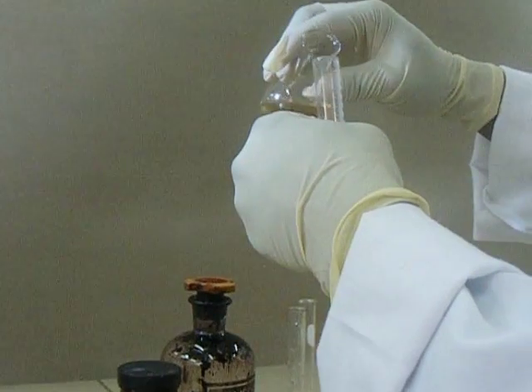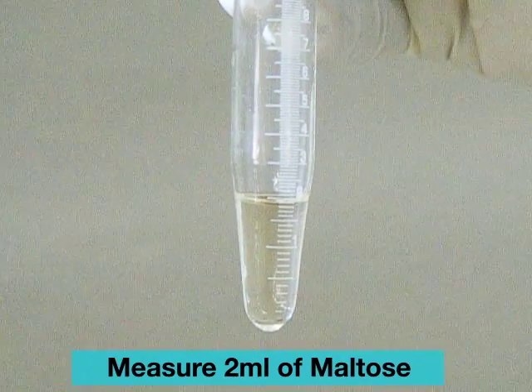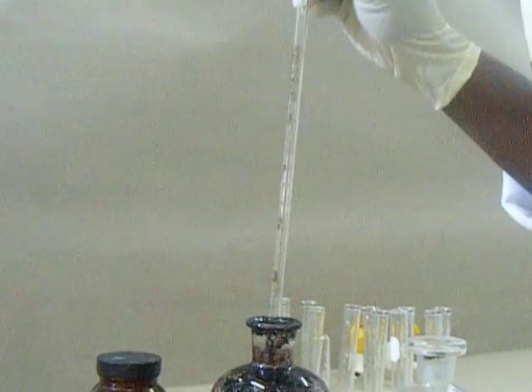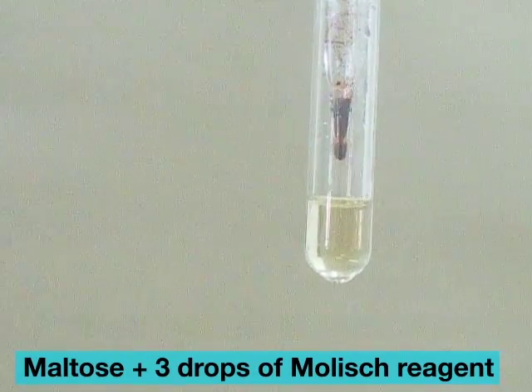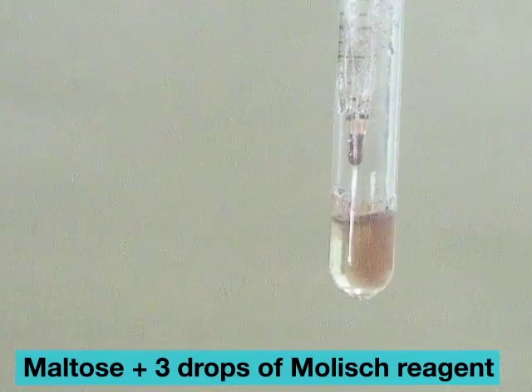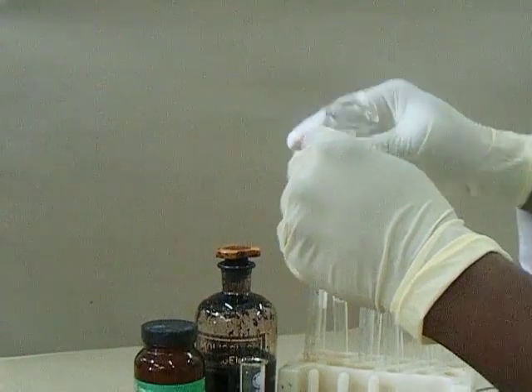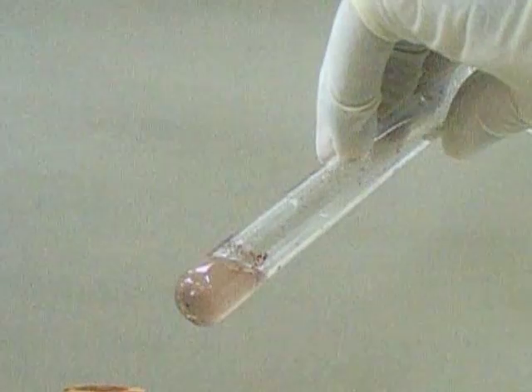Test procedure: measure 2 mls of maltose, a carbohydrate, into a test tube. Add 3 drops of Molisch reagent. Swirl to mix, and run 2 mls of concentrated sulfuric acid slowly along the inner wall of the test tube.